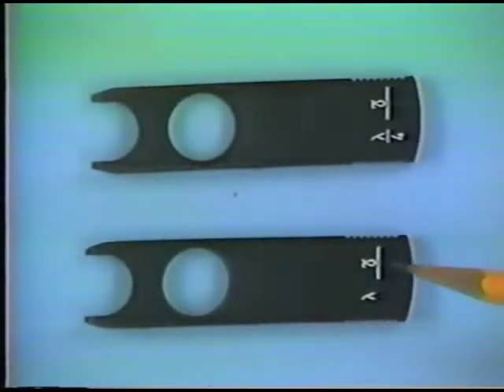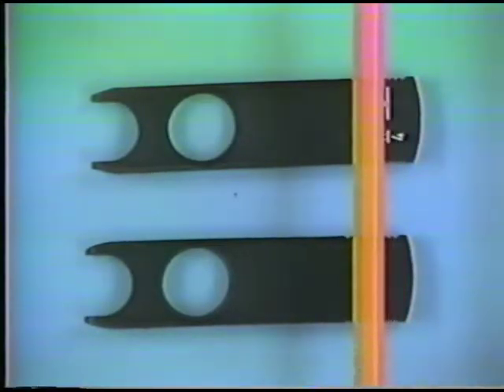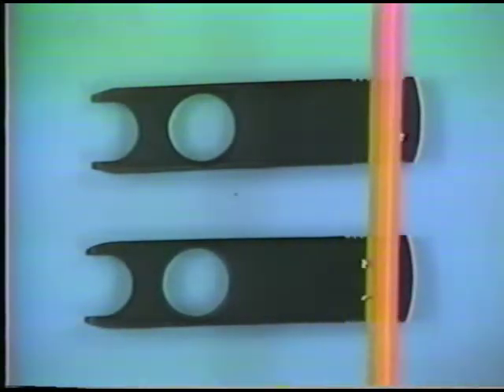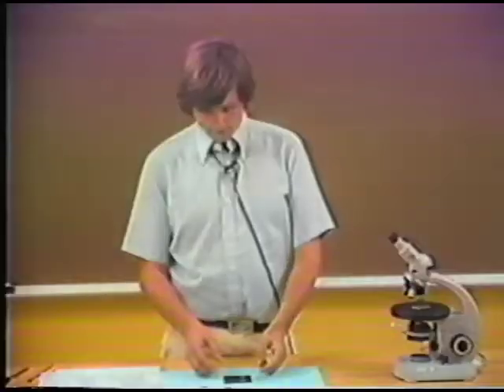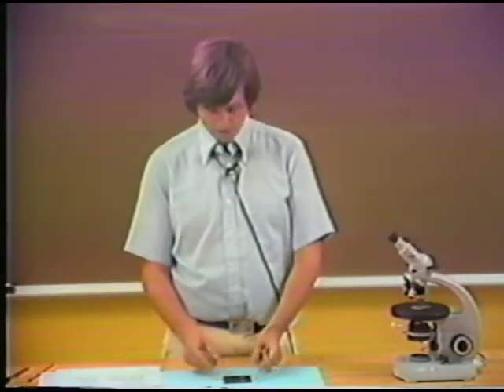They have symbols on them, these particular ones, which show the direction of the slow ray. That's an important thing to take account of. This is the slow ray direction. It happens to go across these particular things. And they also have symbols which show lambda and lambda over 4. Now these symbols refer to the amount of retardation which these accessory plates supply, because that's the purpose of the accessory plate. That is, it is to impose a specific value of retardation on the field of view.